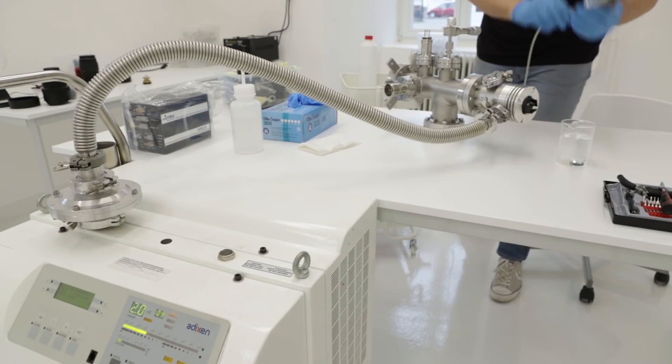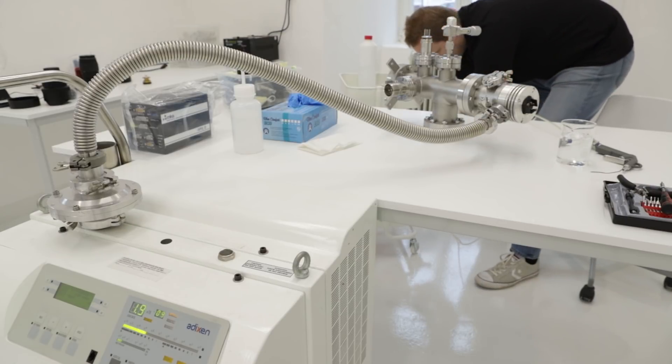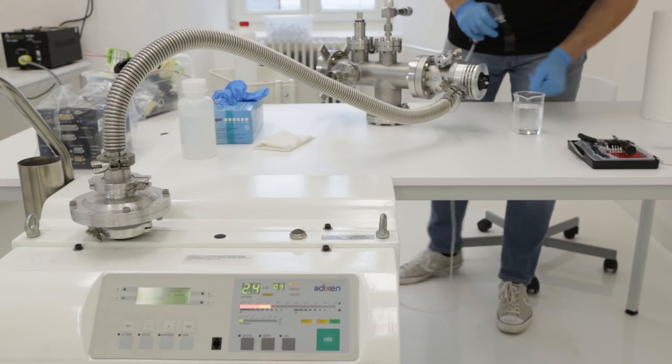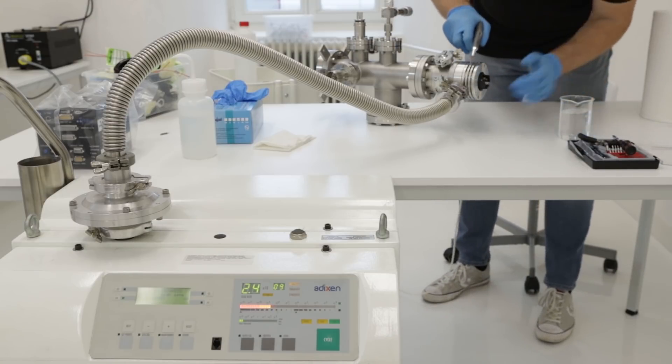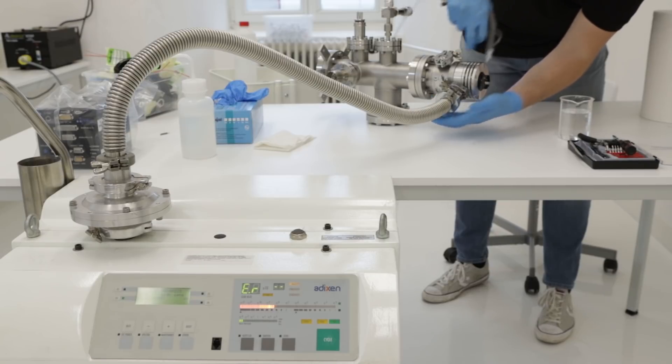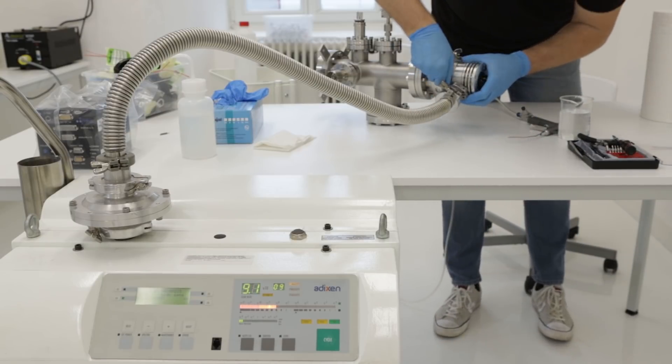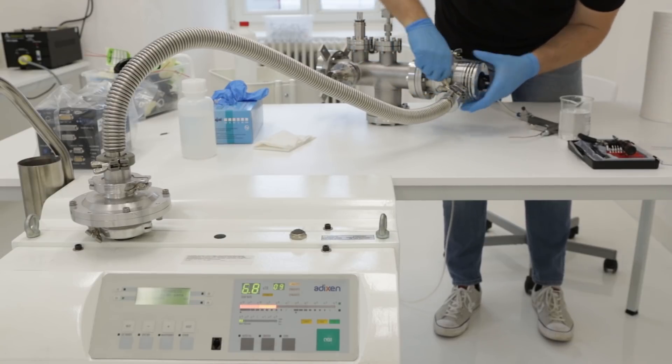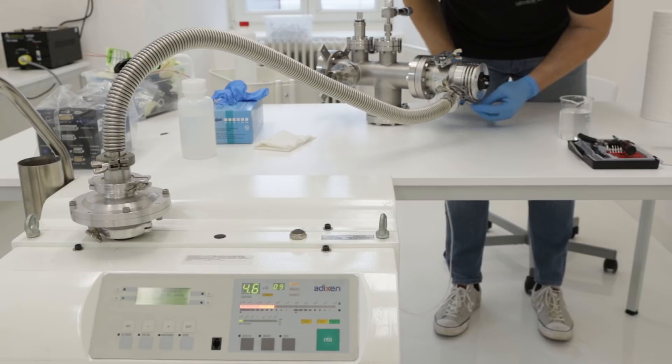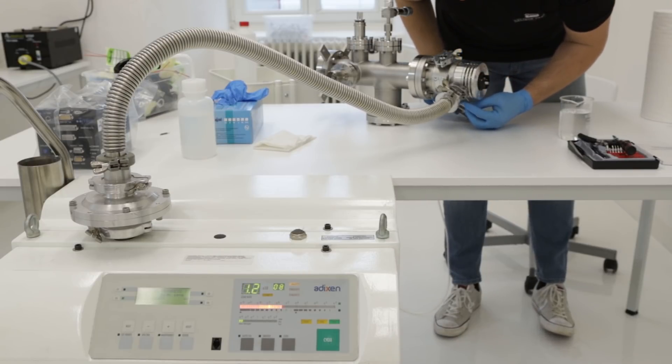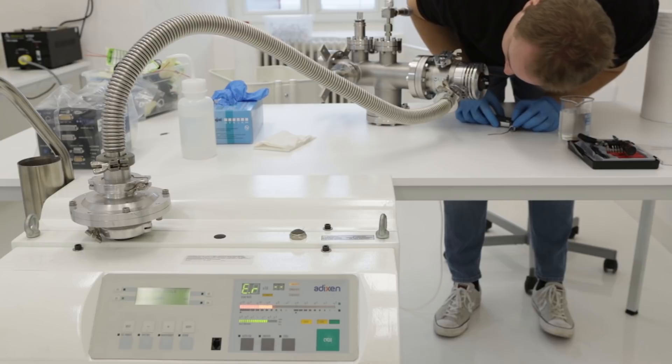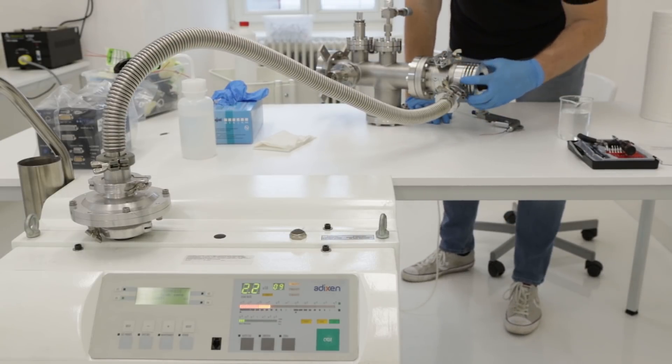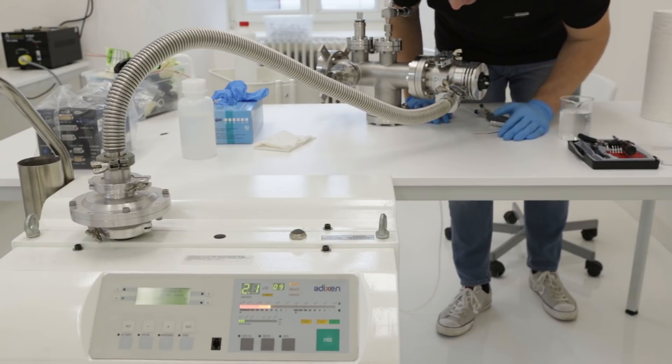The pitch of the tone tells us the amount of helium, so we still have some leak in the system. This is the source of the helium. I can spray the helium around, and when the tone goes up we know helium is entering the chamber. I'm tightening the clamps to make sure helium isn't entering around the clamps. And now you can see the machine turned off the test, so maybe initially it wasn't a leak on the o-ring but somewhere else.